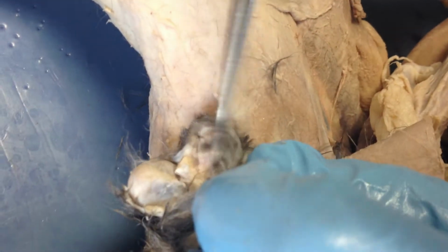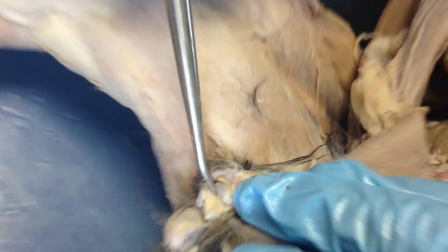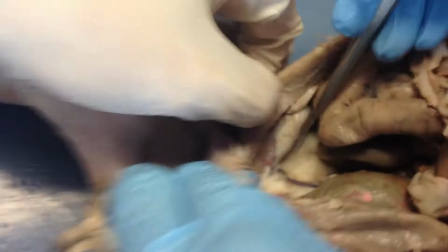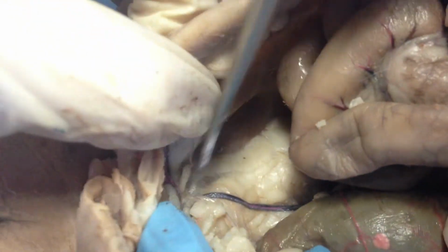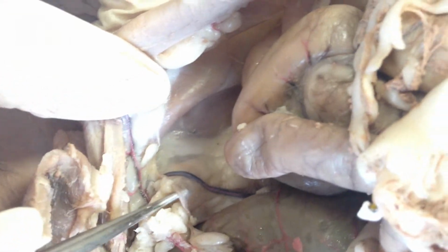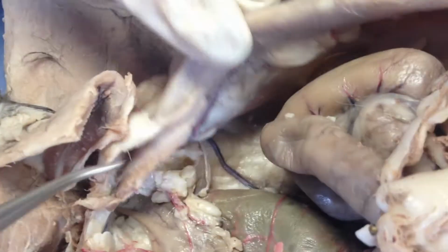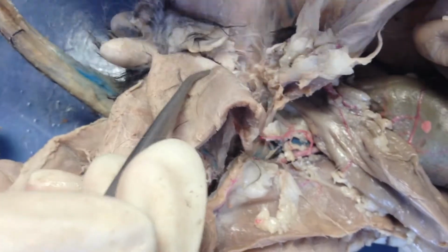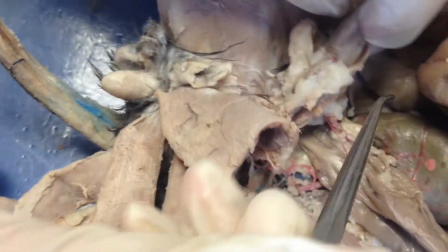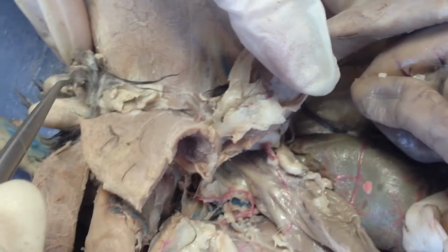The penis is this little guy. The ductus deferens is right here. It kind of looks like a nerve cord, but it's what the sperm travels through. It comes from the testes and goes through the spermatic cord here, which we've accidentally bisected, but normally it would be connected to that and then come to the ductus deferens, and then it comes back around to the penis.